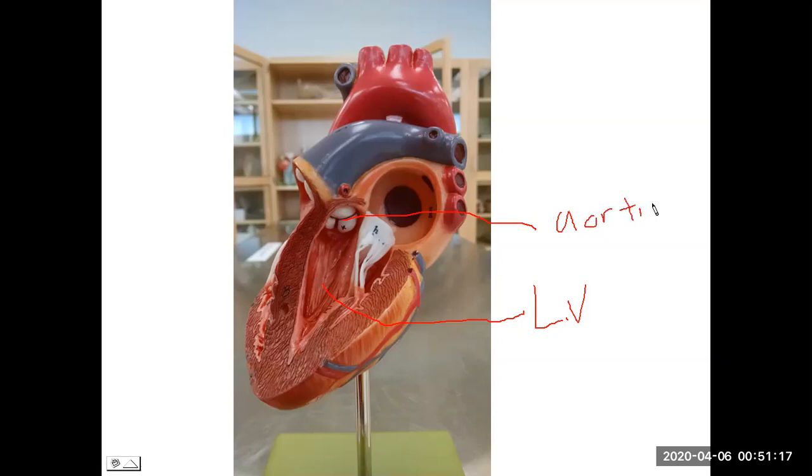And now passing out of that, we have the large artery, the section in particular curving upwards. It's called the ascending aorta. And then as it starts to reach its peak and curve around, there's now the aortic arch, or the arch of the aorta.